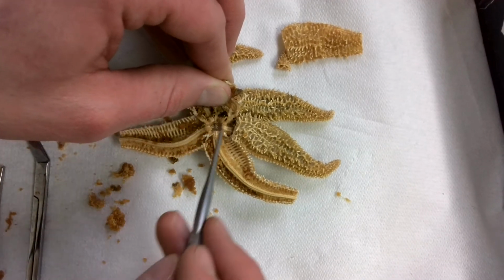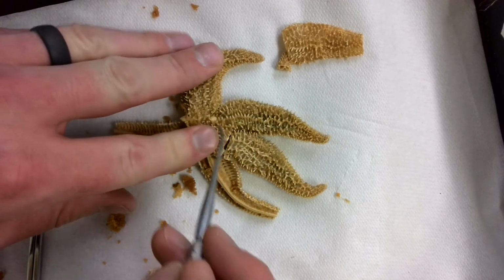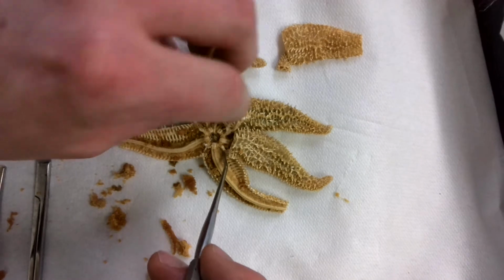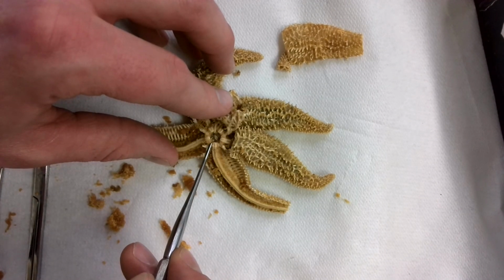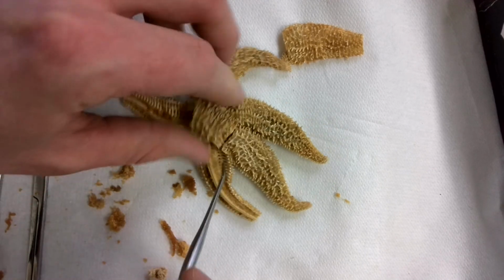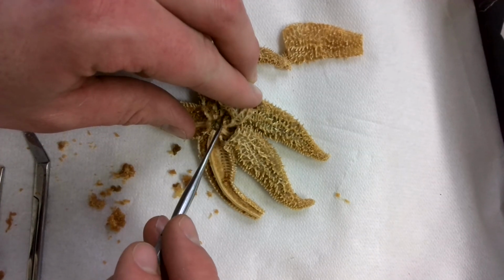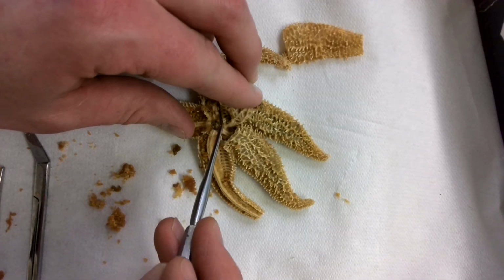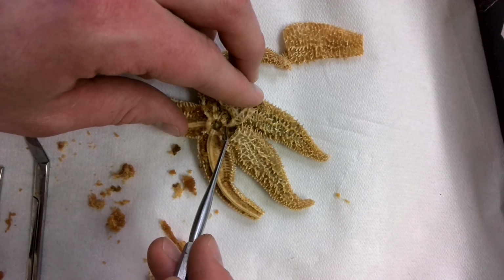So what that is doing is bringing our water from our madreporite right here, then it's going to bring it down to this nice circular canal right here, which is called a ring canal. So we go madreporite, stone canal, and you can see right there, here's our stone canal real well. And it did kind of get torn off a little bit there. So that's our stone canal. That brings water into our ring canal.